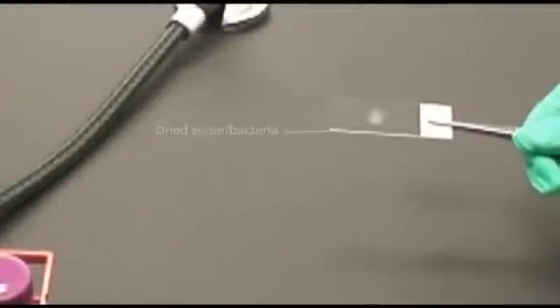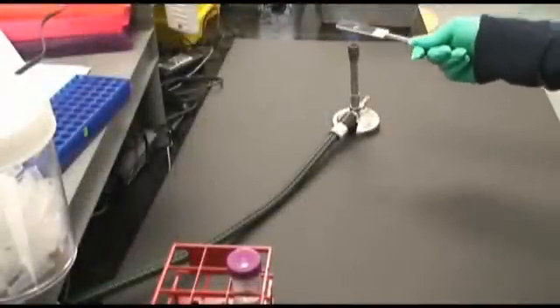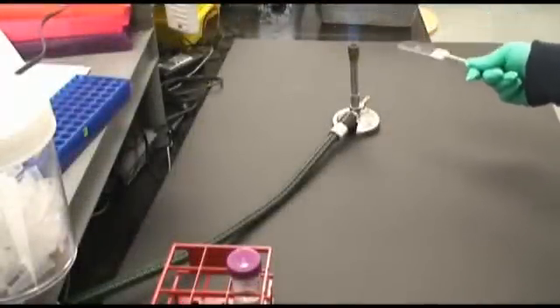Once dry, the bacteria are killed and fixed to the slide by passing the slide through a flame. Make sure that the bacteria never come in contact with the flame.